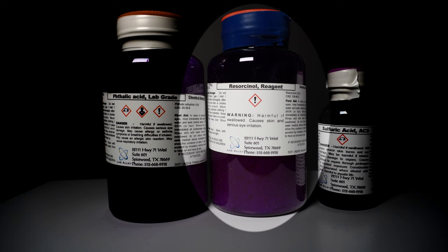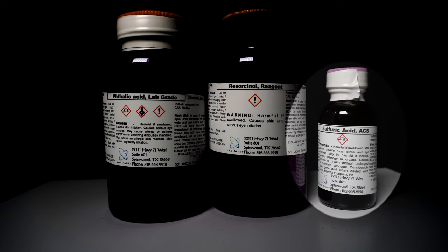Next we have resorcinol, which is commonly used in skin treatments to treat things like acne, psoriasis, and other skin disorders. Finally, we will need a small amount of concentrated sulfuric acid as a catalyst.